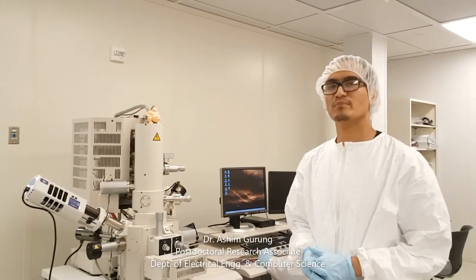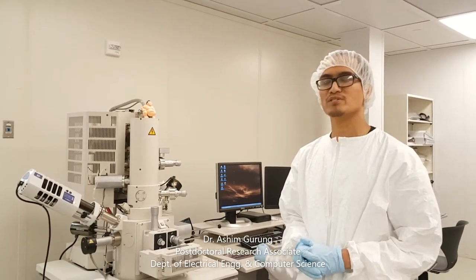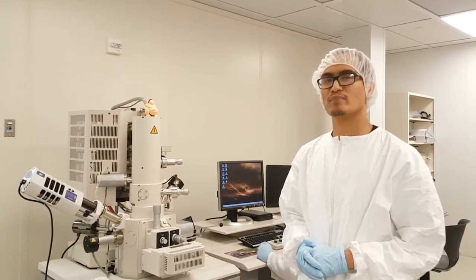Hi, my name is Asim, and today we're going to show you sample imaging by using our scanning electron microscope.